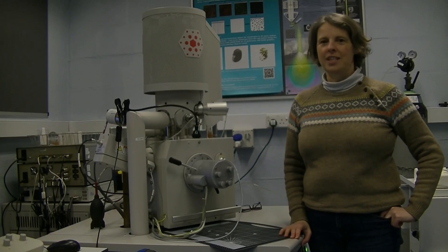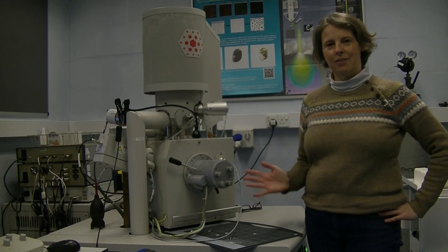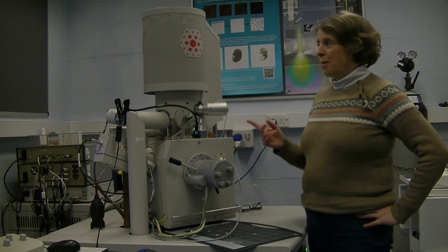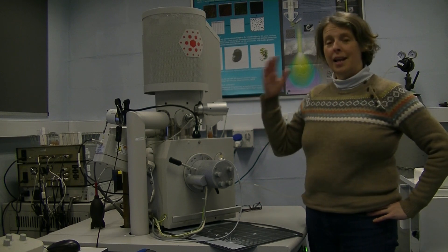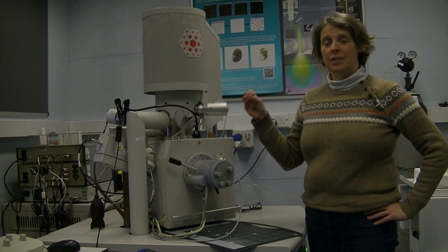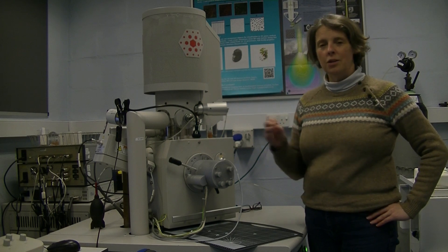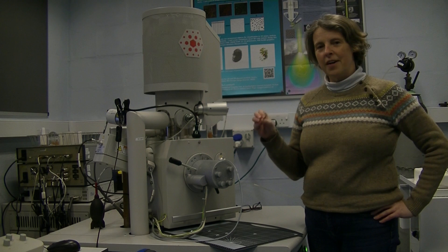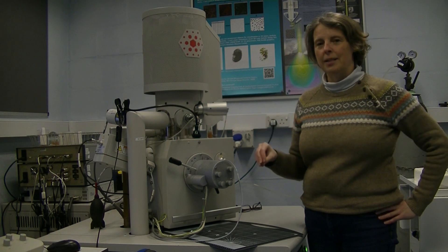Hello, my name is Patricia and today I'm going to tell you a little bit about scanning electron microscopy. Scanning electron microscopy allows us to use electrons to take images of samples at very high magnification and also very high resolution. That means we can see finer and finer details in the samples that we're looking at.